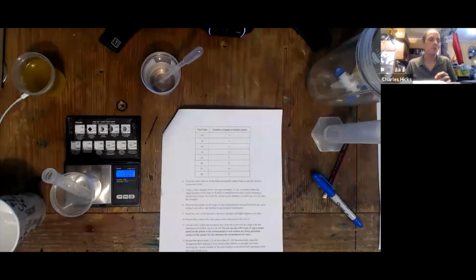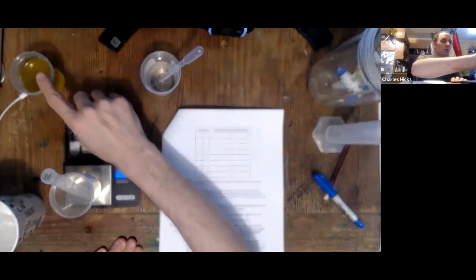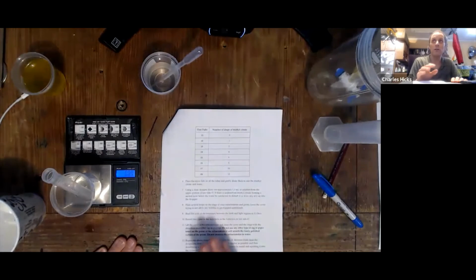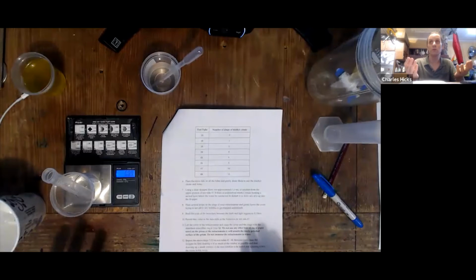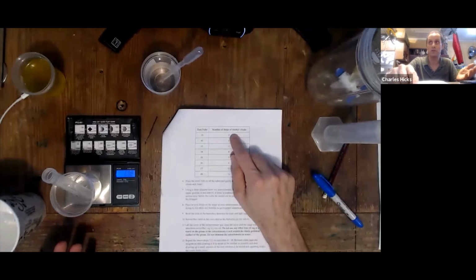Now, in the next part of the experiment, you have to prepare a number of standardized solutions. And this procedure that I'm going to demonstrate briefly, you're going to do for both water-based solutions and oil-based solutions. Each one of those is going to have a whole set of solutions that are prepared. The first solution for both of them is the solution that has none of the triethyl citrate added.